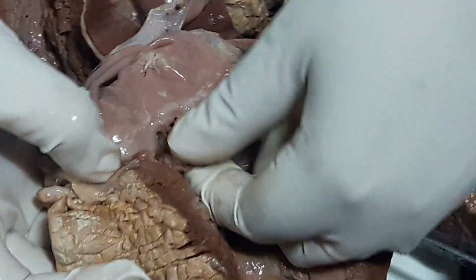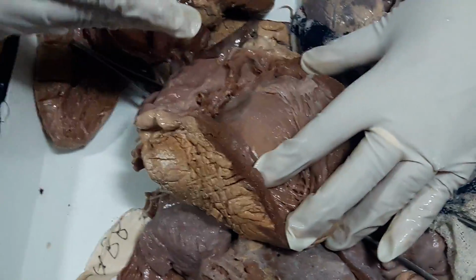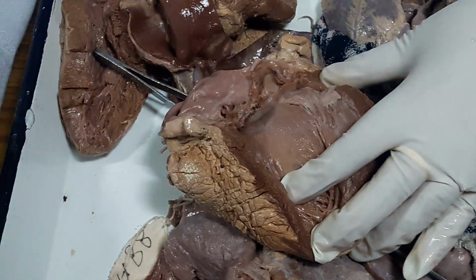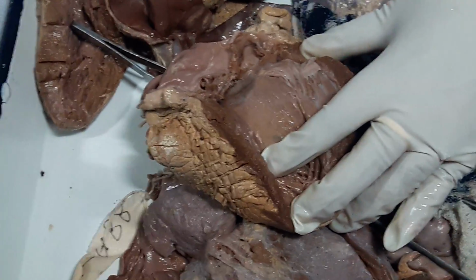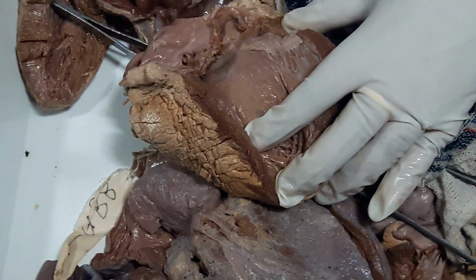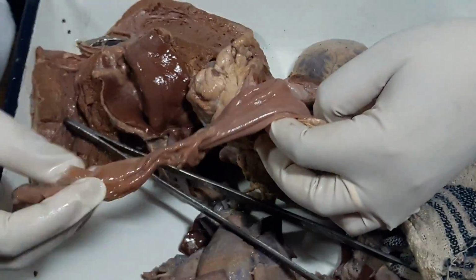Okay, then you have to see the perforation of the valve first. Okay, and you have to decide whether it was to start with a bicuspid valve or a tricuspid valve. Now it is very difficult to decide, but sometimes it will be possible by examining whether there are 2 commissures or 3 commissures. In case of tricuspid valve, you will see 3 commissures, whereas in case of bicuspid valve, there will be 2 commissures. Here I cannot really decide right now. Okay, and aorta shows atherosclerotic plaques.